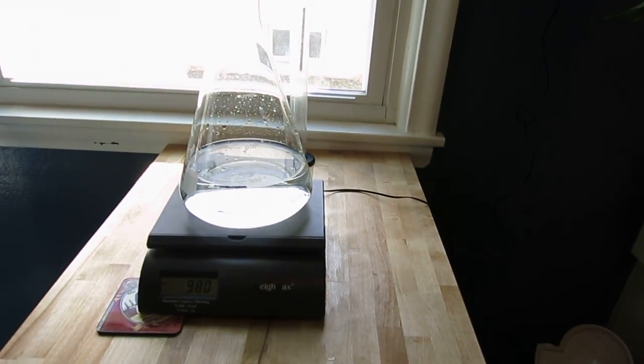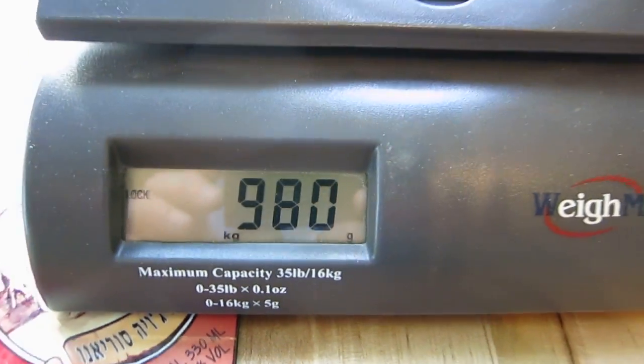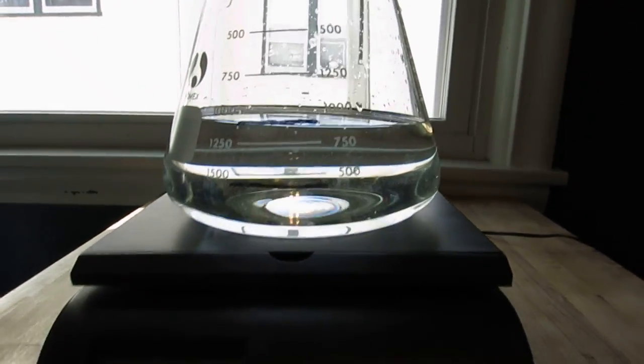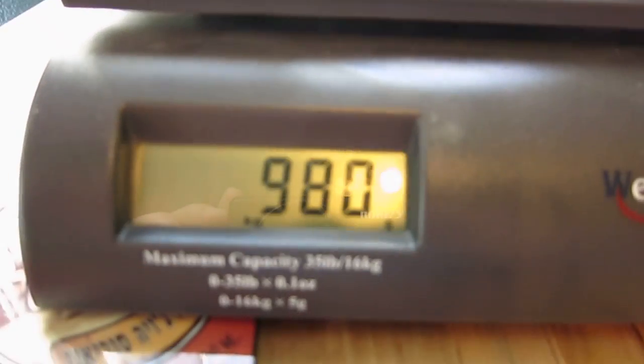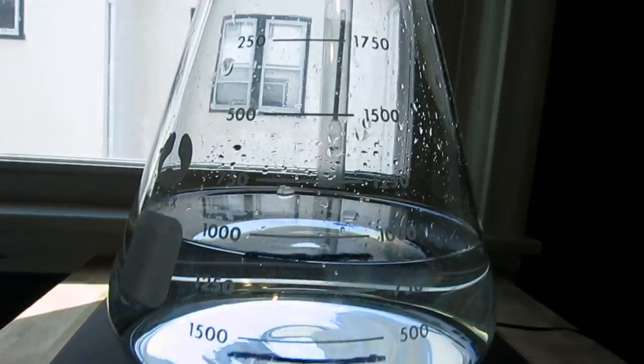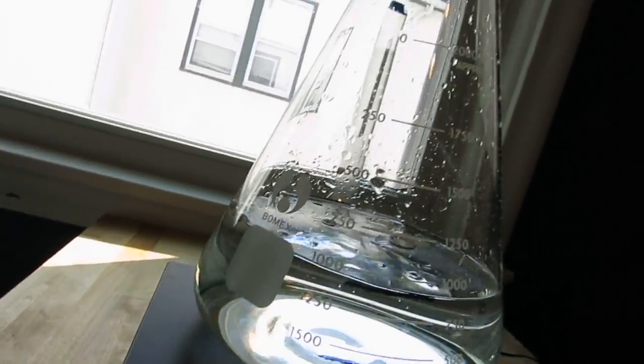So I wanted to do a short follow-up on this. The science people have told me that the best way to do this, and the table's not really that even, as you can see, is to weigh water until you get to a kilogram. So this scale was tared out, and shoot, now it actually takes like 10 seconds to, oh no, it doesn't.